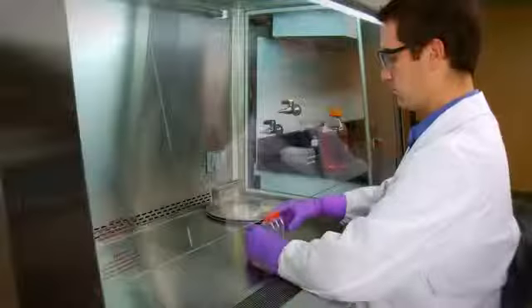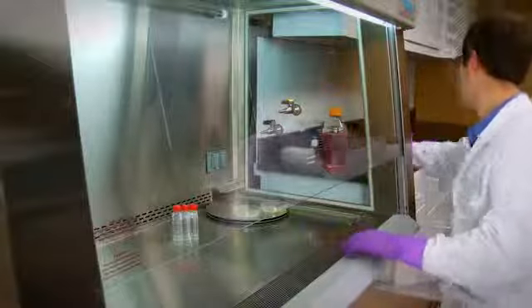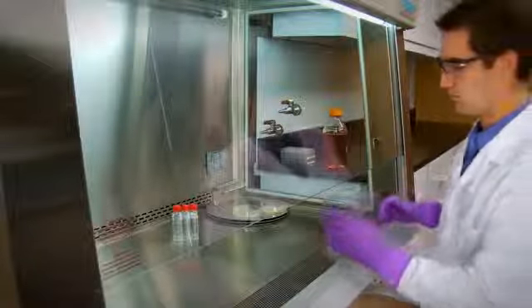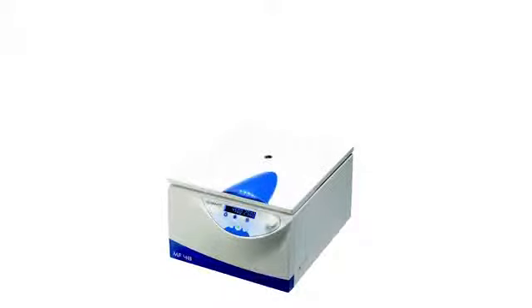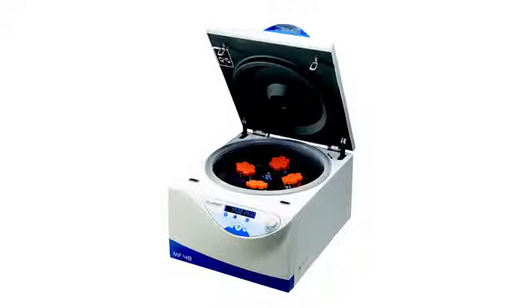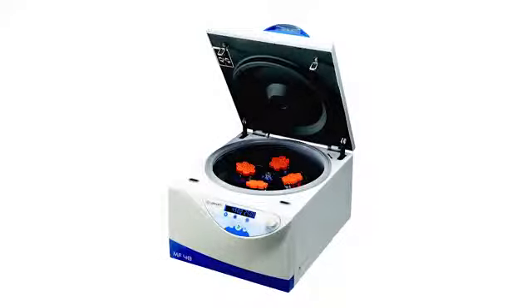All materials should be placed as far back in the cabinet as practical, toward the rear edge of the work surface and away from the front grill of the cabinet. Similarly, aerosol-generating equipment such as vortex mixers or centrifuges should be placed toward the rear of the cabinet to take advantage of the air split.